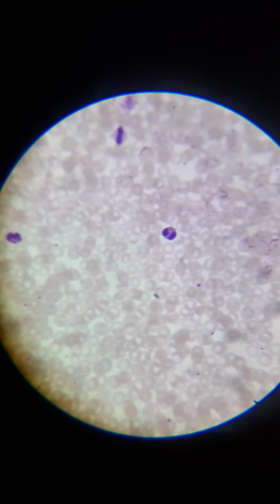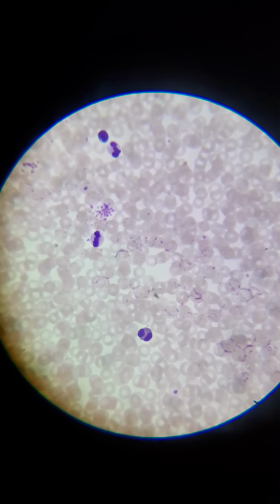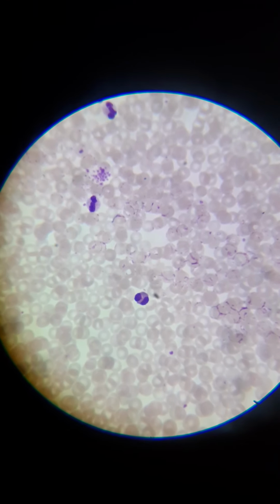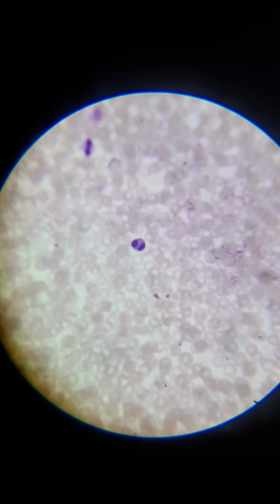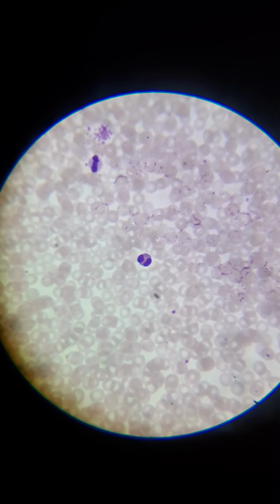That's interesting. This one right here has two sections of nucleus separated. Basophil. I wonder if that's what's called a basophil. They make up about 1% of the white blood cells in the blood, but I'm not entirely sure on that, to be honest. So I'm going to take this out here.